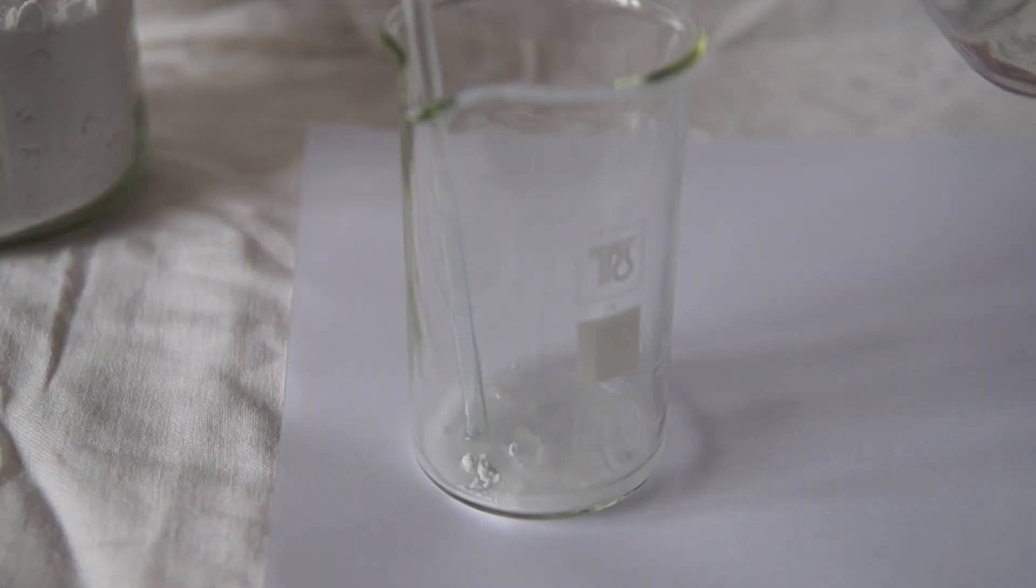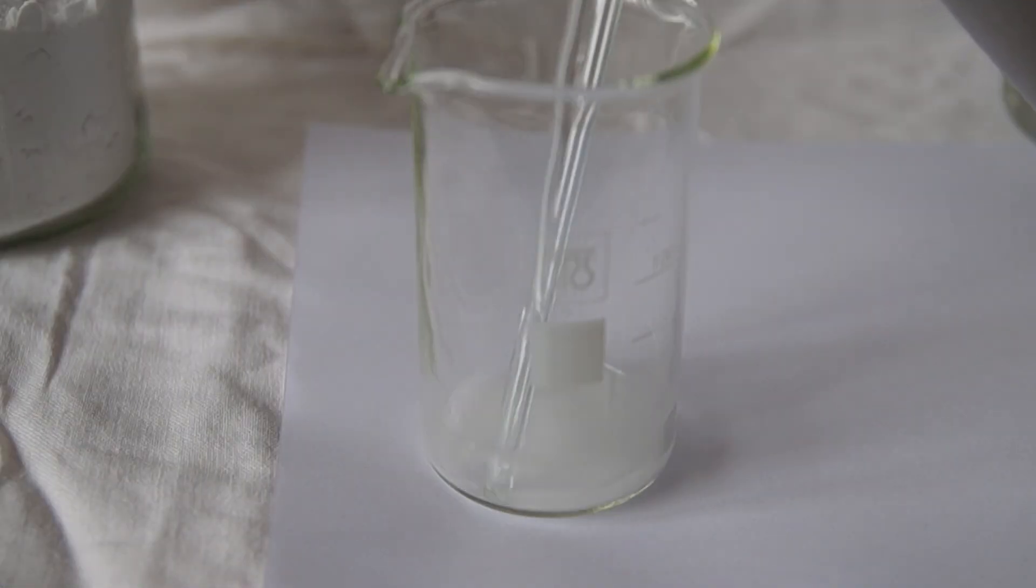Dissolve starch in cold water, then pour boiling water into the beaker to better dissolve starch. The solution becomes slightly cloudy.